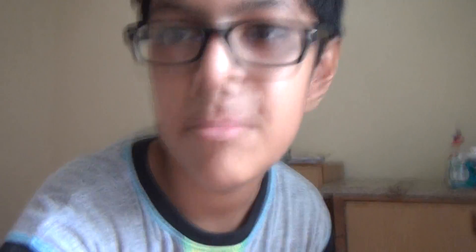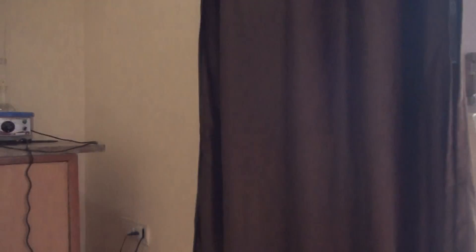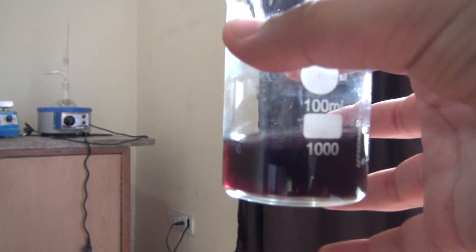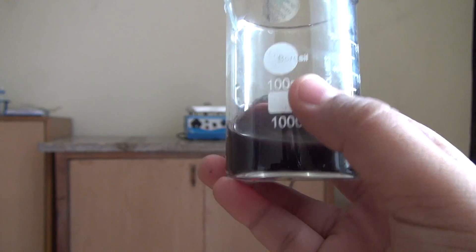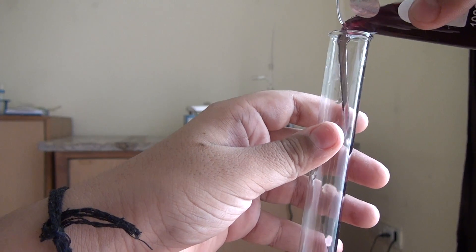Let's get started. I'll keep my camera here and keep my stuff here. Got my prill. Now before we begin, I want you to see the original color of the extract so that you don't get mistaken. Here is the test tube, and here is the hibiscus extract — as you can see, it's a bit reddish-purple. Interestingly, my camera is detecting it as a flower, which technically it is — flower petals.